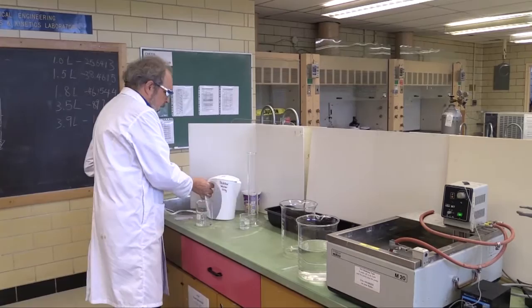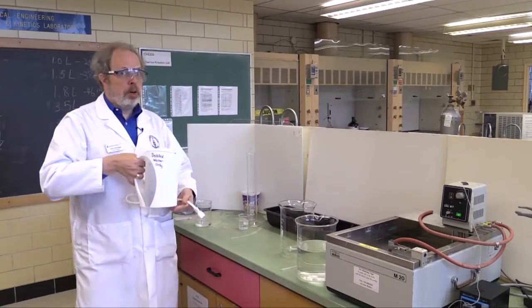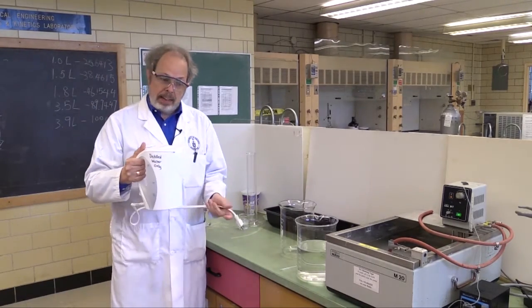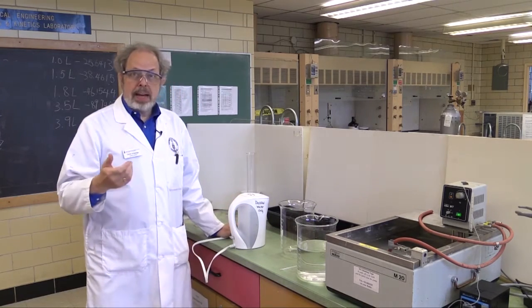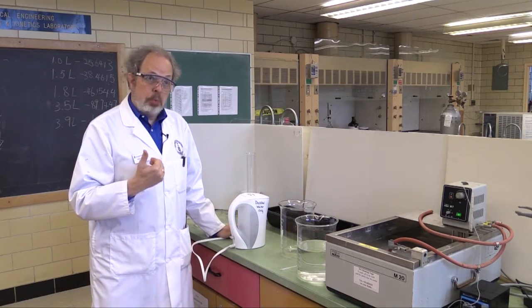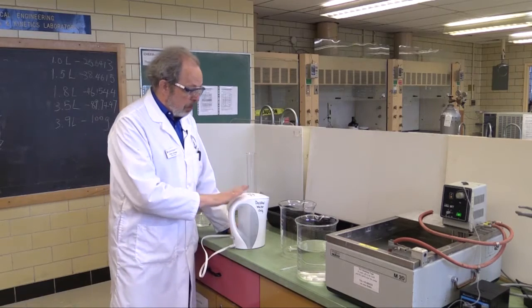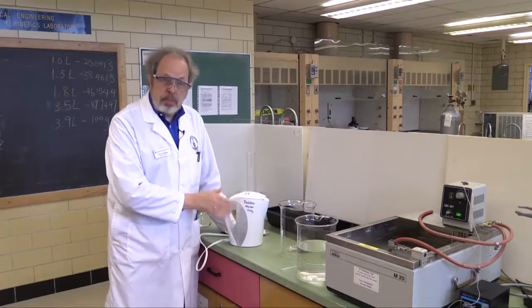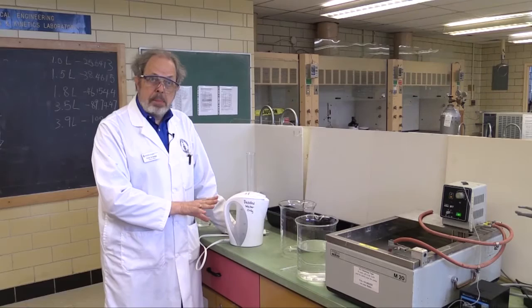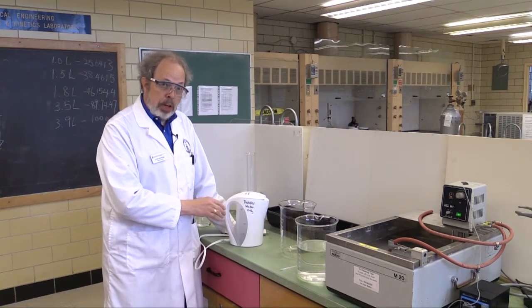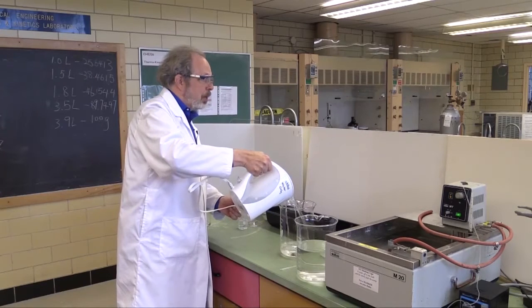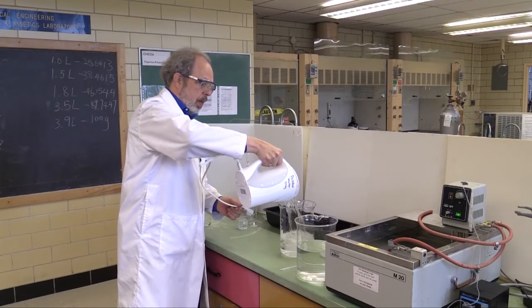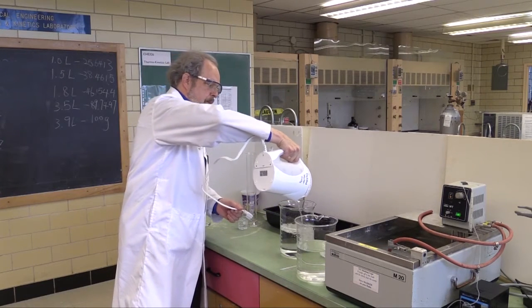We have a water heating device that you've probably already seen. It's a kettle, and because you're going to be heating reactant, it does need to be filled with distilled water. So, fill the kettle up to 1.7 liters, which is the maximum, and bring it to a boil, and then pour that.